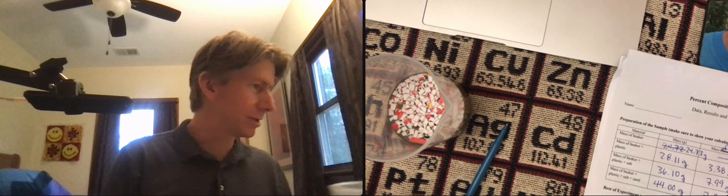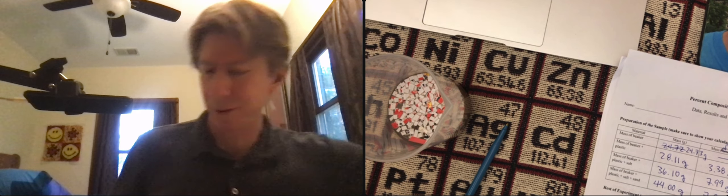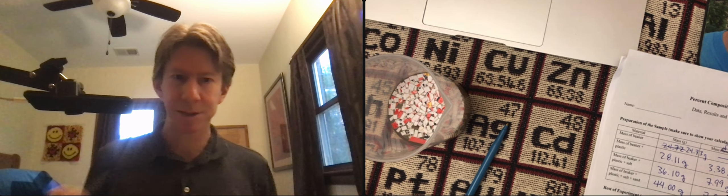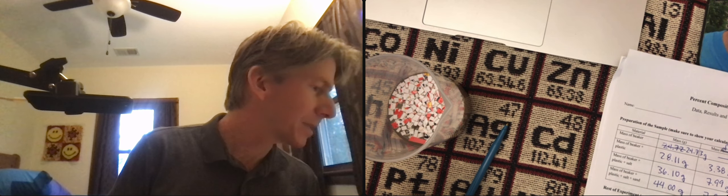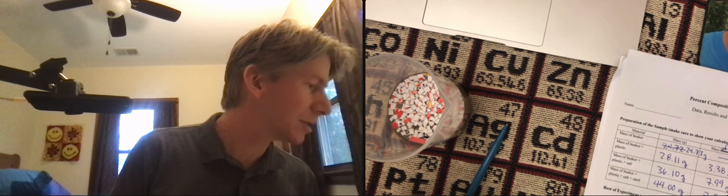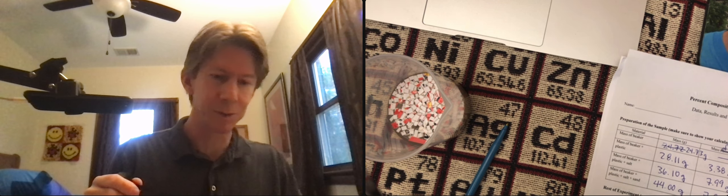So I have approximately 100 there. Put that water down. And then I've got my spoon over here, and it says use the back of the spoon to mix the sample in water thoroughly.